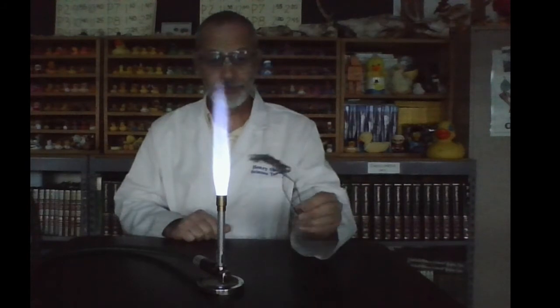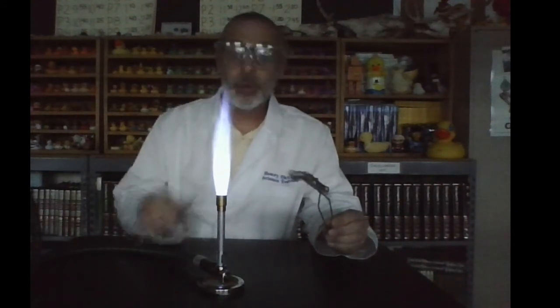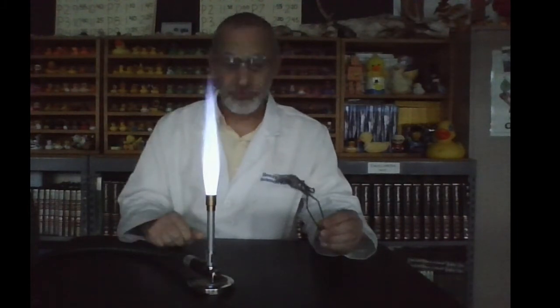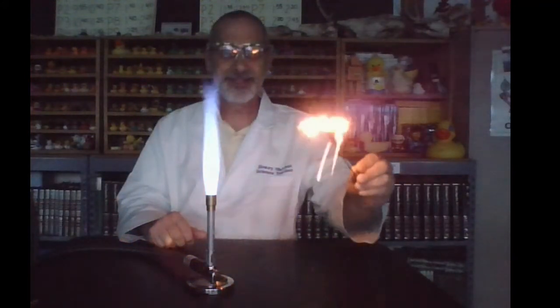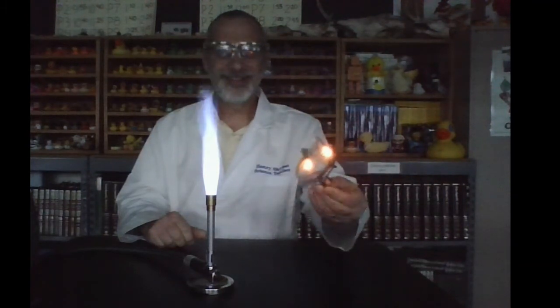So here we go. Once I put it in, you will notice a reaction taking place. When we notice a reaction taking place, we'll remove it from the flame and observe.